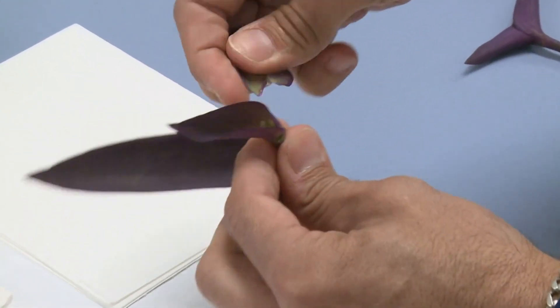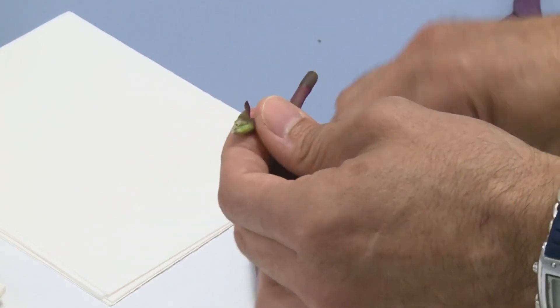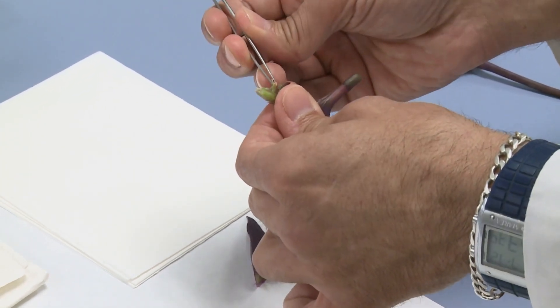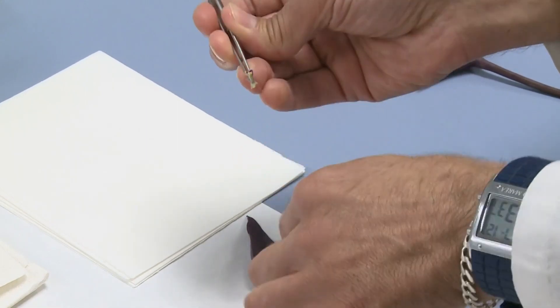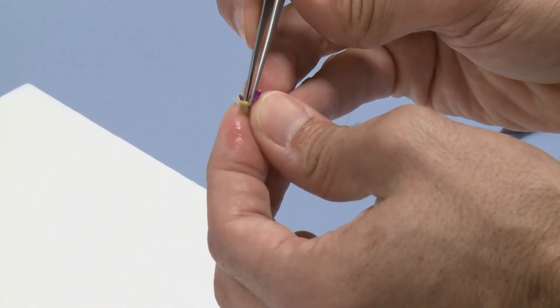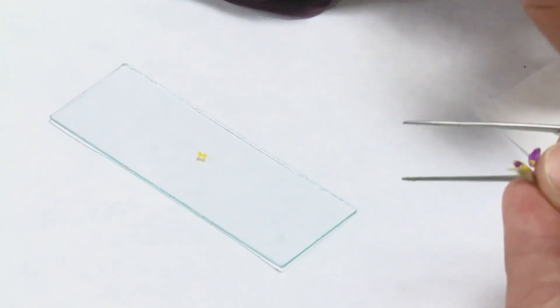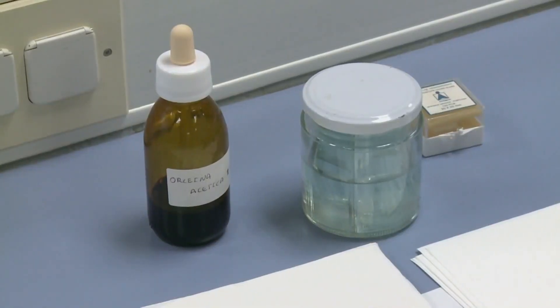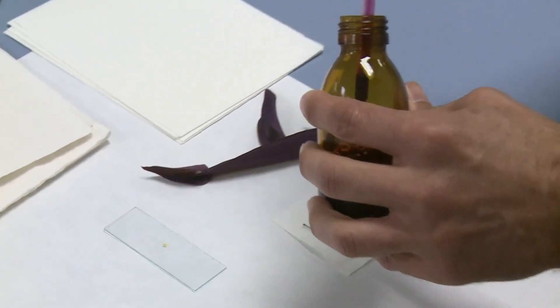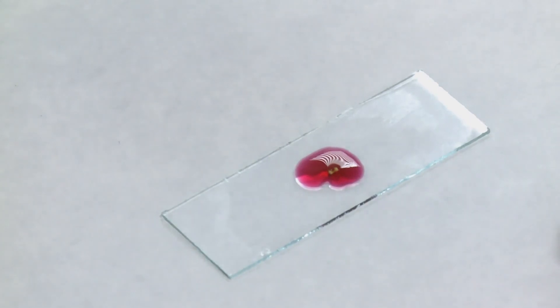We pick a flower that is still closed. We take out the leaves, and here we have the flowers, and with the help of our forceps we pick a flower that is still unopened. We pick the flower and we extract some of the anthers. In this example we are extracting anthers that are yellow, so probably at the end we are going to see pollen grains. We put the anther on a slide and we use orcein to stain the cells and to avoid the cells drying. So we put a drop of orcein on the slide with the anthers.